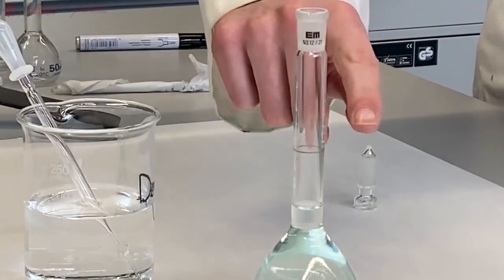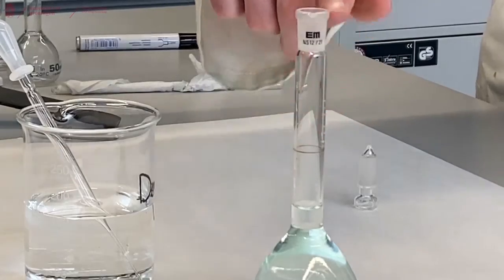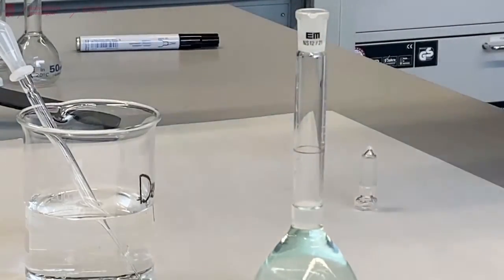As you can see, I accidentally actually got some droplets here, so I have to make sure it's dry before I continue.